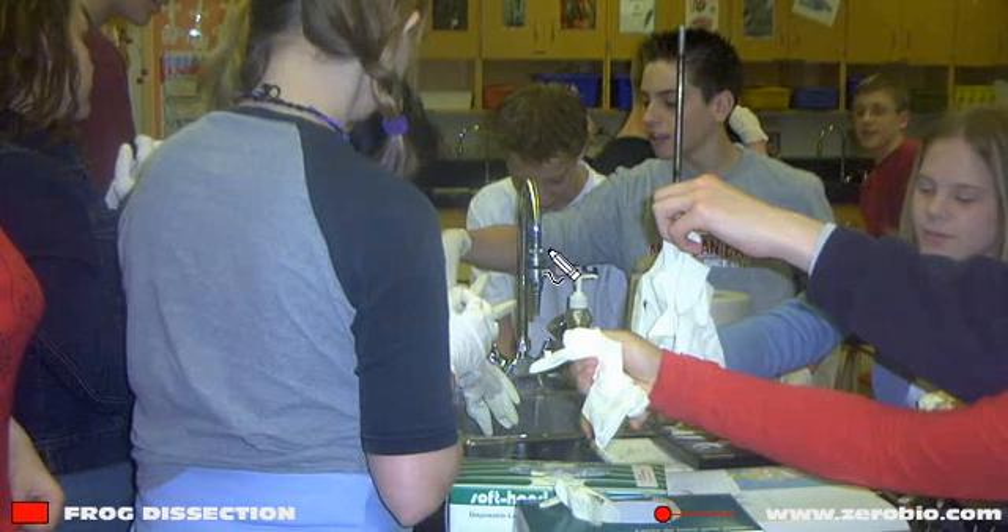You're also going to need to make use of water — the tap here — washing off your frog to get off some of the preservative, and we've got some soap. You don't want to put that on the frog itself, but you can wash the dissection equipment at the end of the dissection, and of course wash your hands as well.